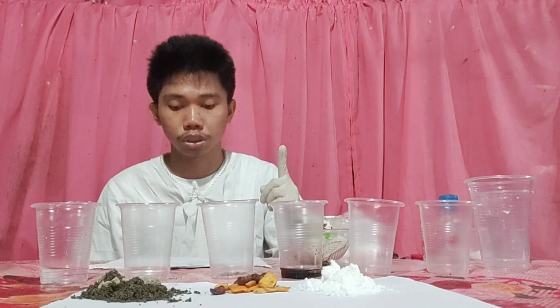So lastly, we will now proceed to the methods of separation of the samples. First, salt and water: evaporation.